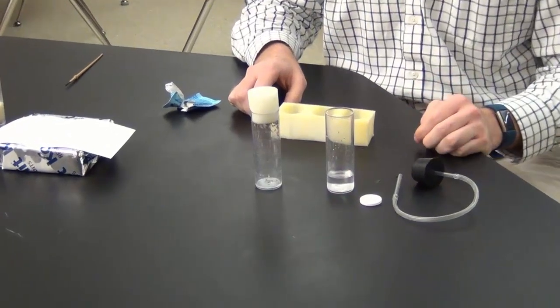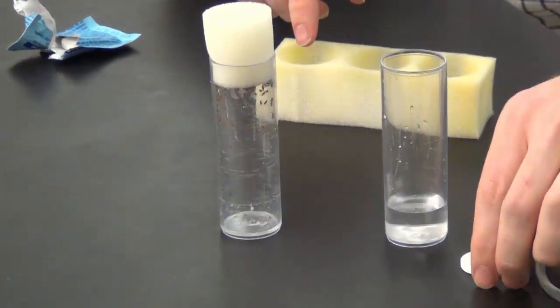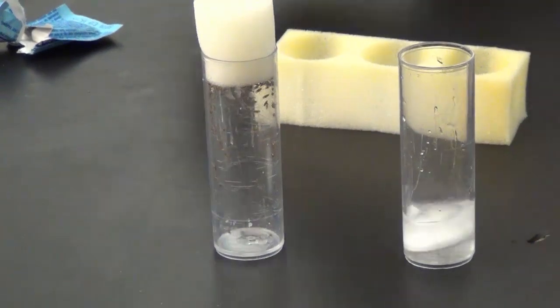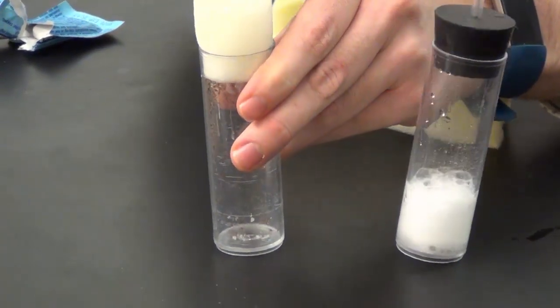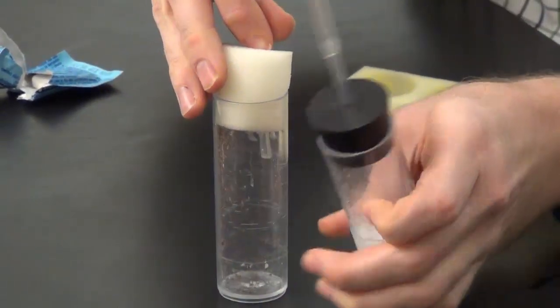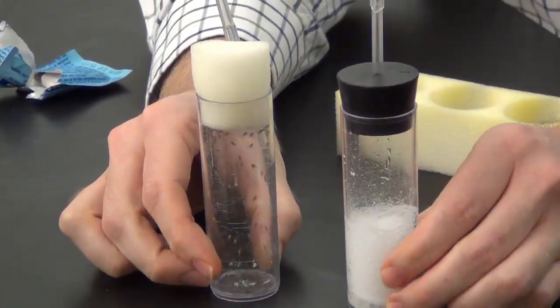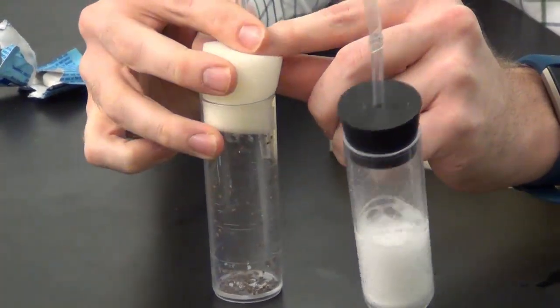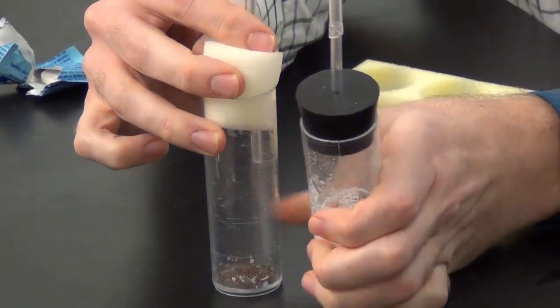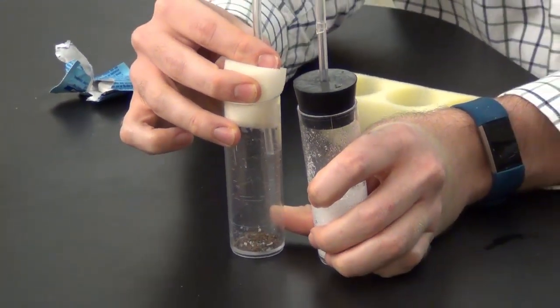Alright guys, so I'm just trying to show you the materials you're going to have in lab to anesthetize the flies. I have some live flies here. You're going to have a little Alka-Seltzer tablet that generates carbon dioxide. And when you drop it into the little bit of water that you see there, you're just going to plug the tube. And then there'll be a little plastic tube that you just quickly put in between the foam plug and the vial with the flies in it. You'll see that pretty quickly puts them out.